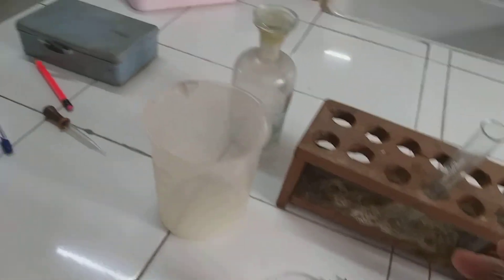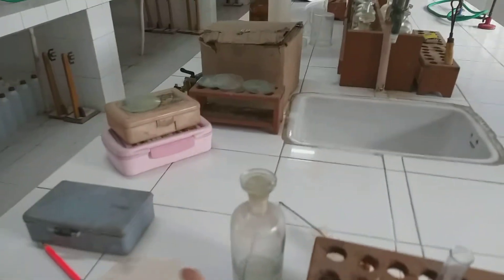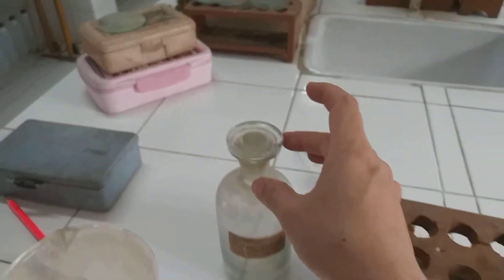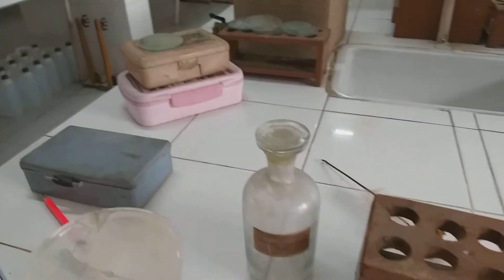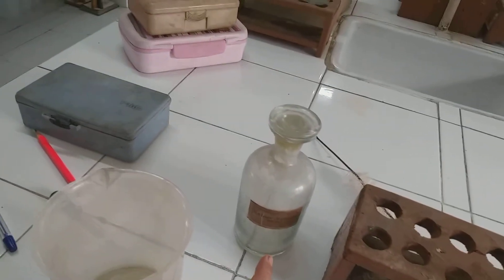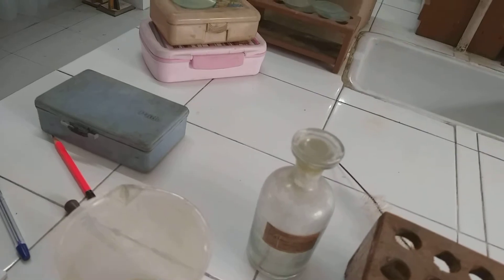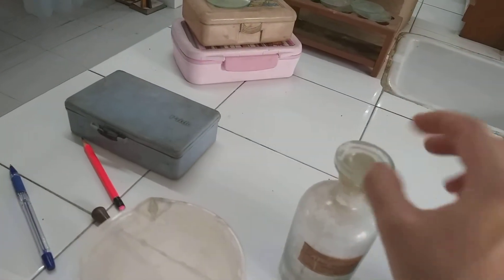We use the brush for cleaning the test tubes. Now this is a glass bottle in which we keep various substances. This is called a reagent bottle. It is completely made up of glass, along with the stopper, so that it does not react with the chemicals.